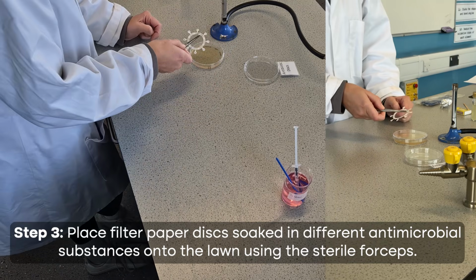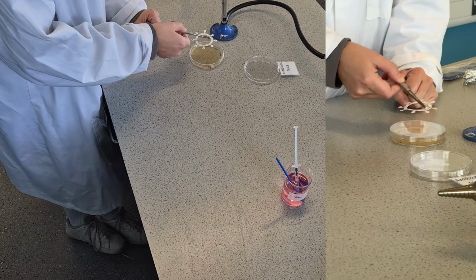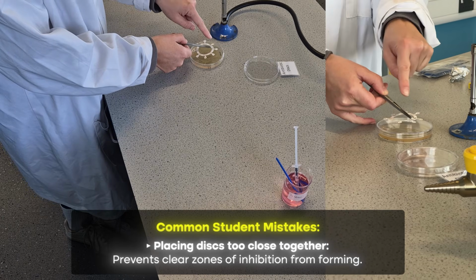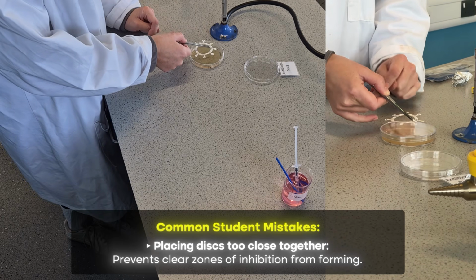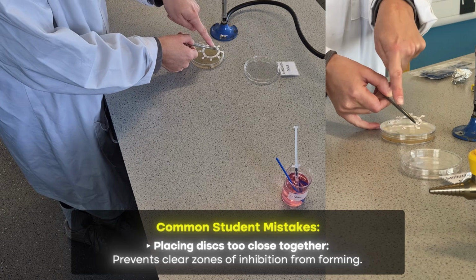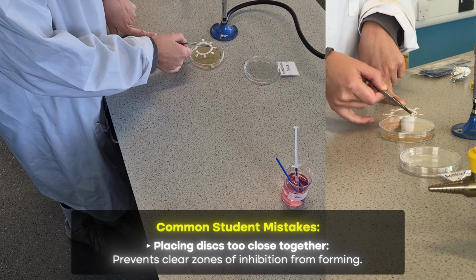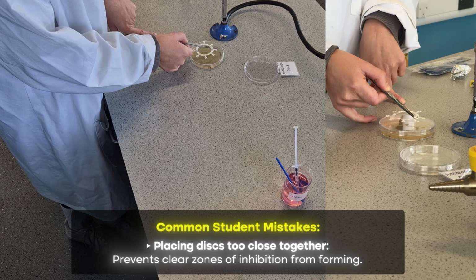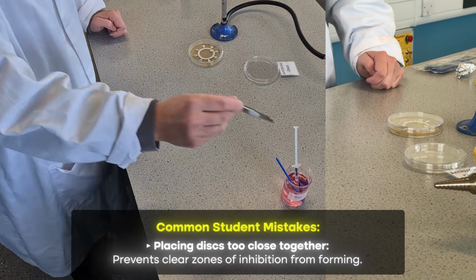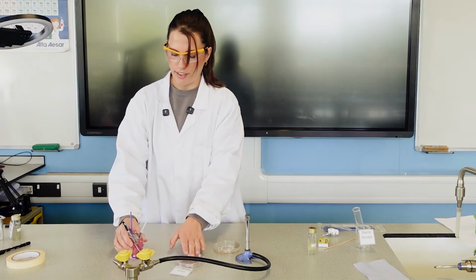And this is where we get a common mistake students make, that once they put it down, you need to put it down correctly the first time, because the antibiotics will imprint straight away and it affects your inhibition zone. And you don't want it too close to the edge so that you can't get a circle. That is the inhibition zone. So I need to lift this up and make sure I place it right in the middle, which is the tricky bit. And then those forceps go into our disinfectant.